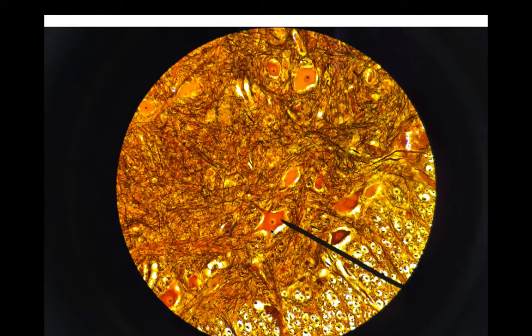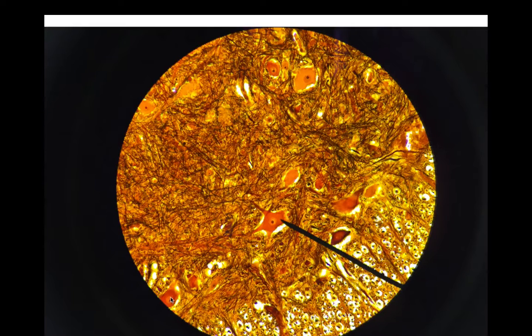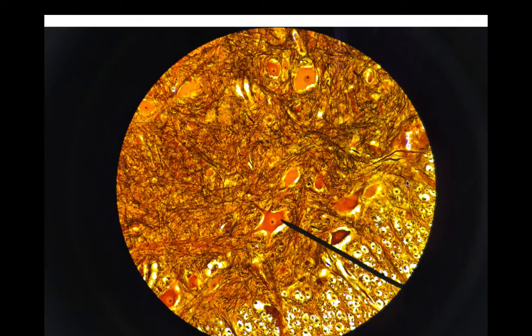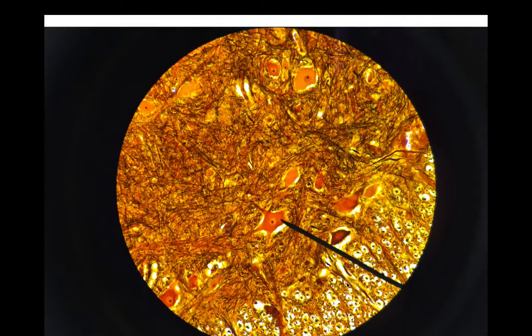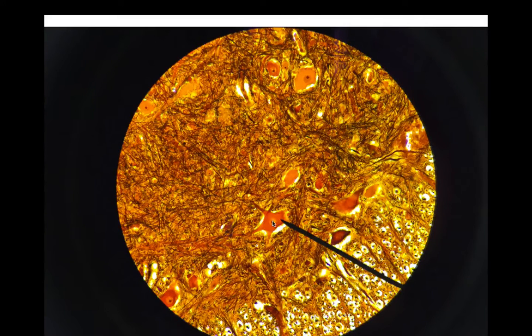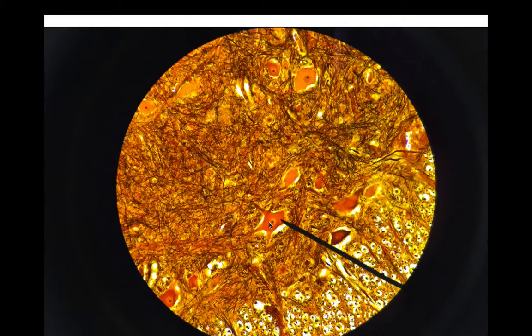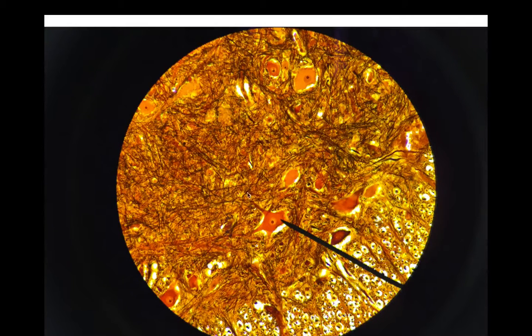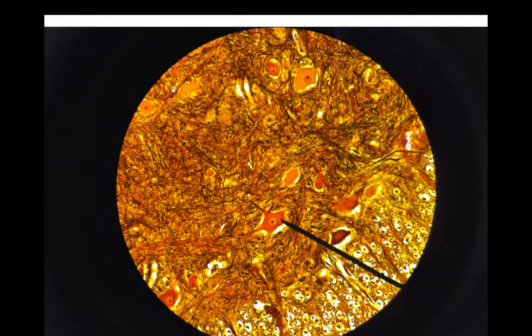Here, this is showing you the cell bodies hanging out in the anterior horn. You know they're neurons — see the dark-stained nucleolus and the lighter-stained nucleus. From here this is gray matter, and this is going to be your white matter where you're just seeing myelinated axons. Who lives in the anterior horn of the spinal cord? We know they're multipolar neurons. These are somatic motor neurons — somatic meaning they are going to the skeletal muscles. Somatic motor neurons live in the anterior horn of the spinal cord.